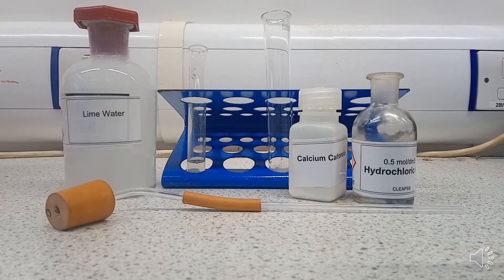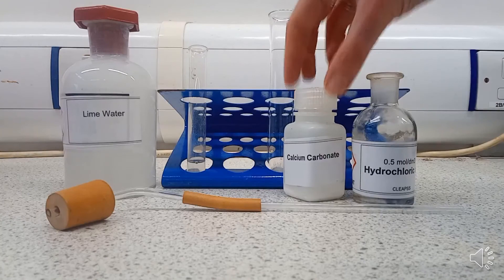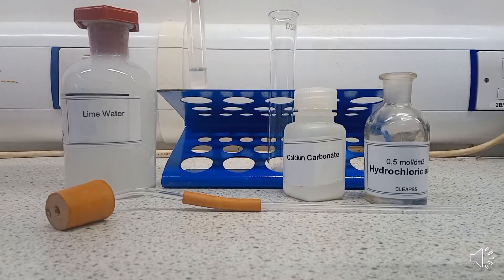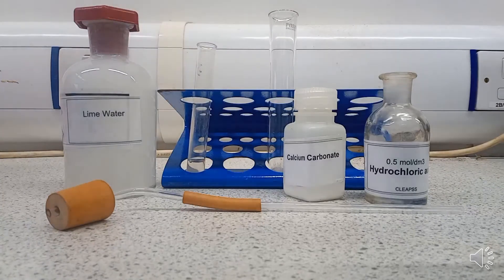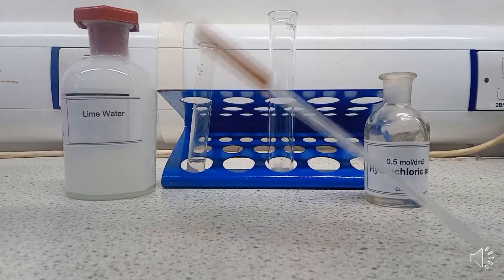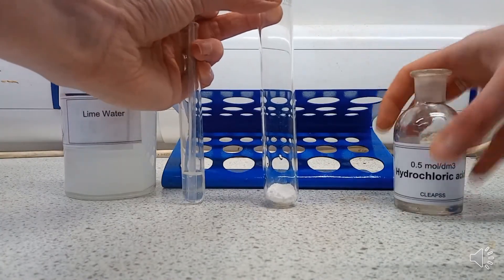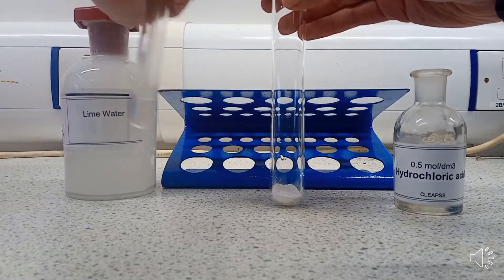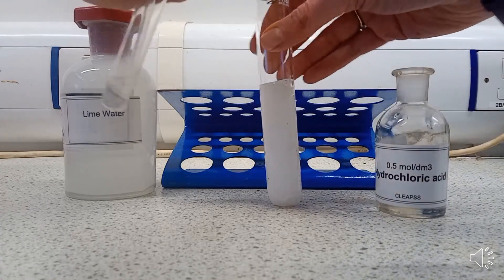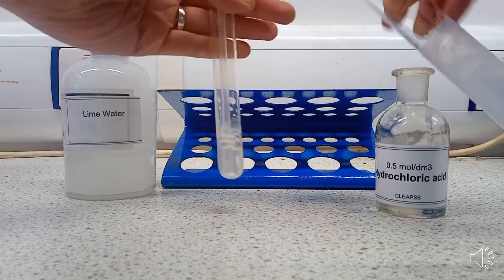This final test looks for carbonate ions. The first part is to decompose the carbonate using acid — this white powder is calcium carbonate, and to it we add some hydrochloric acid. They react to make carbon dioxide, a salt and water. We then prove the gas is carbon dioxide using lime water — aqueous calcium hydroxide — bubbling the gas through it. At the moment it's colourless and transparent, but in the presence of carbon dioxide it makes a white precipitate and turns cloudy. With the delivery tube in the lime water and a bung sealing the tube, the acid goes in, and you can see the lime water starting to bubble and slowly turn translucent as that white precipitate forms.